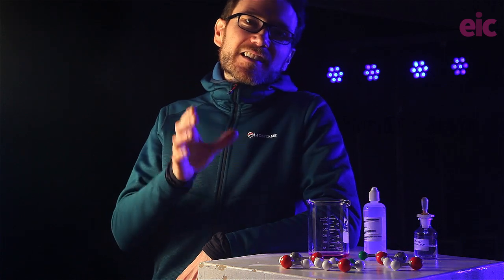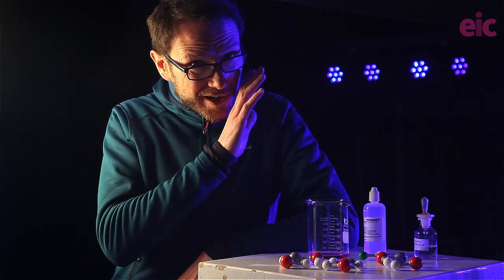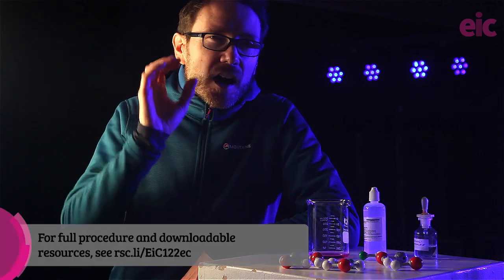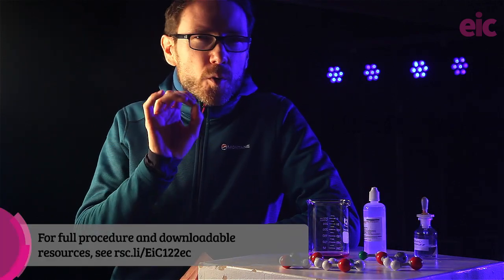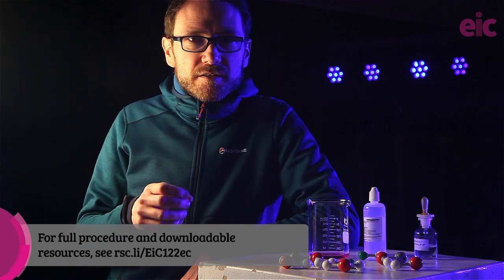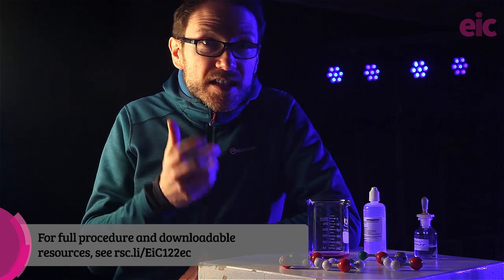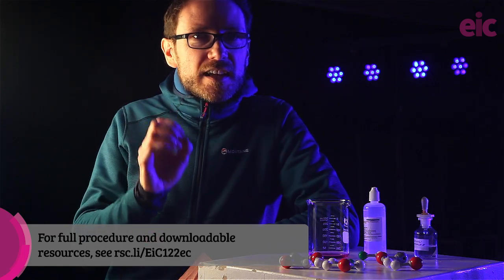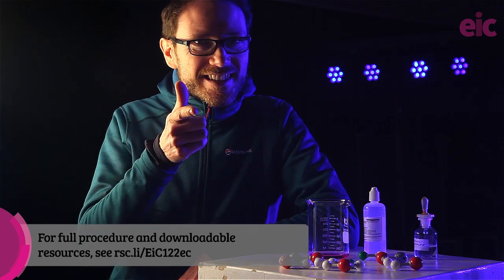One thing that does scale in a linear fashion, at least at lower concentrations, is the conductivity. I've fine-tuned this demo specifically to show what happens to the ions in a neutralization reaction, and there are lots of tips along the way for getting the best possible results on any budget. Watch carefully and you'll see how to get beautiful results like this.